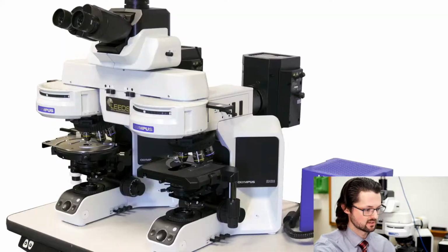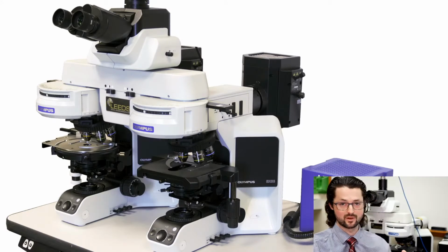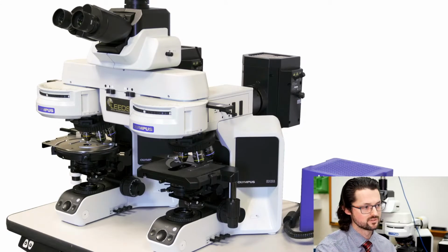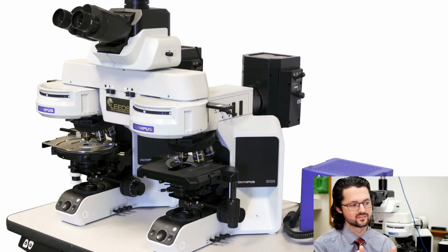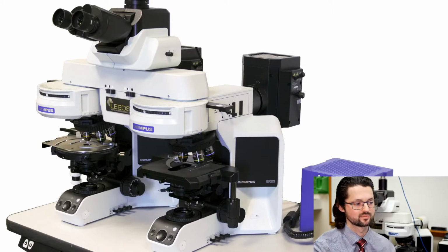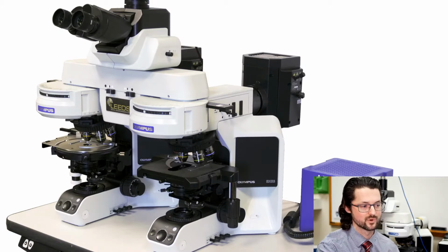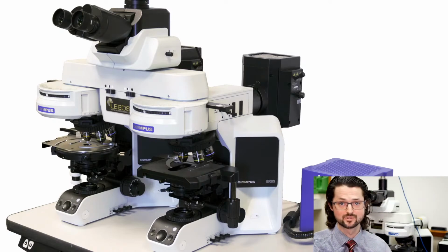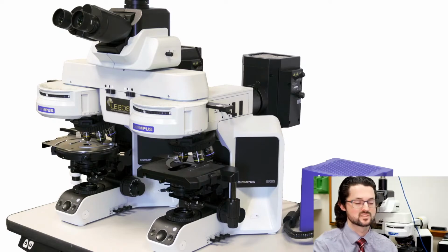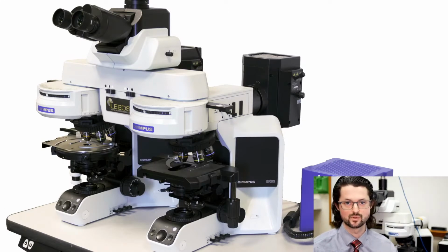So let's bring this one back. With this example of the mercury burner on my comparison scope for fluorescence, if I wanted to add in a separate light source for reflected light, frequently what I'd have to do in the past is put a Y-split right at where this mercury burner attaches to the reflector. And on that Y-split, we would attach another light source, a halogen light source. And so you'd have to switch between the mercury arc lamp or the halogen light source, depending if you're doing reflected light bright field, reflected light pole, those type of things.